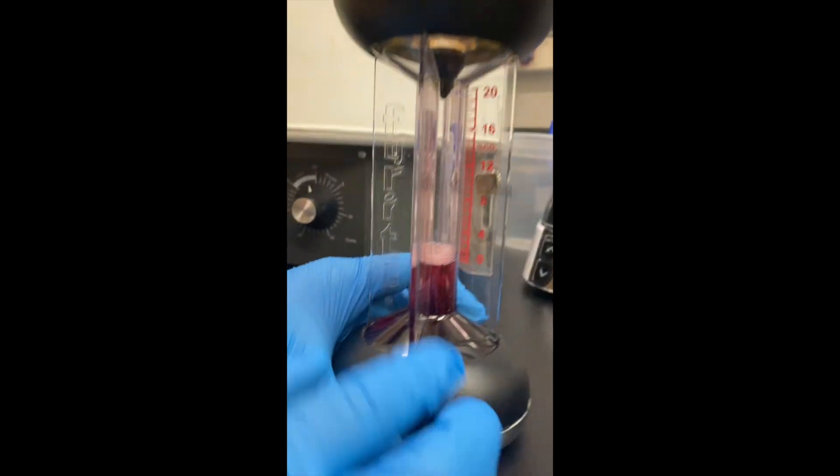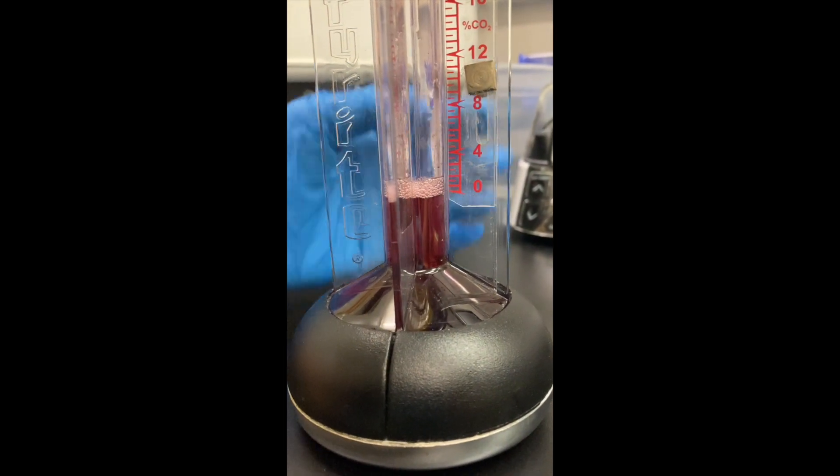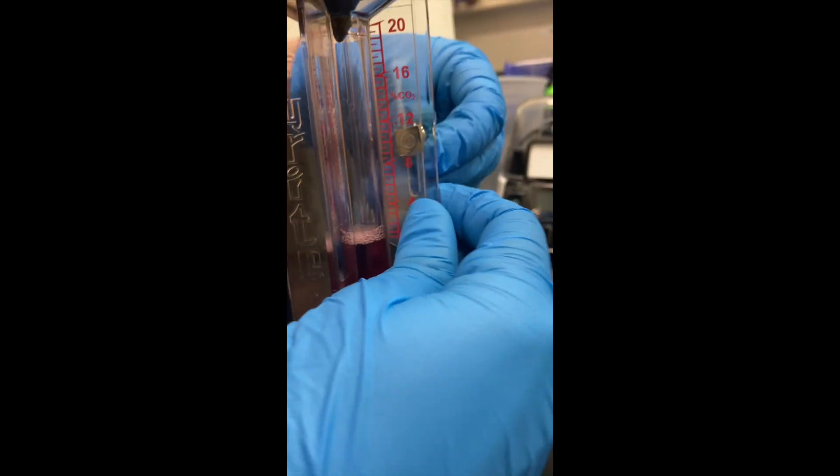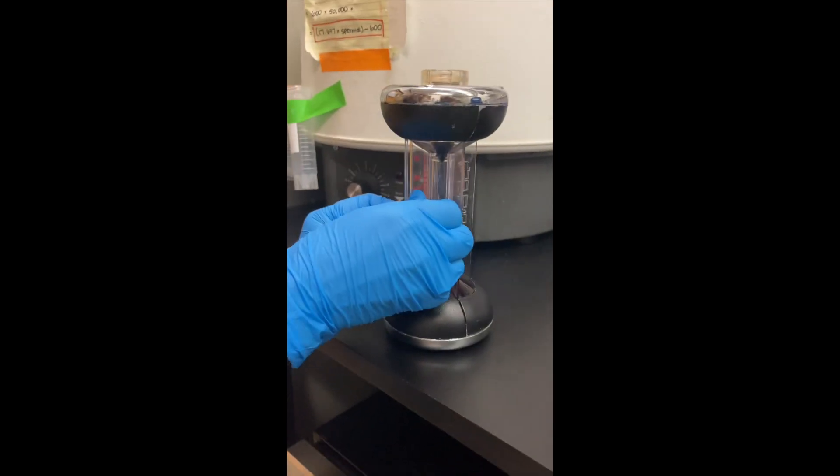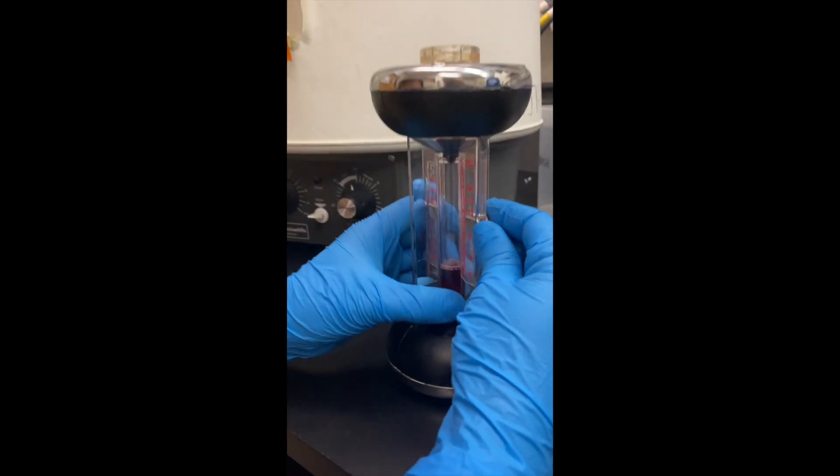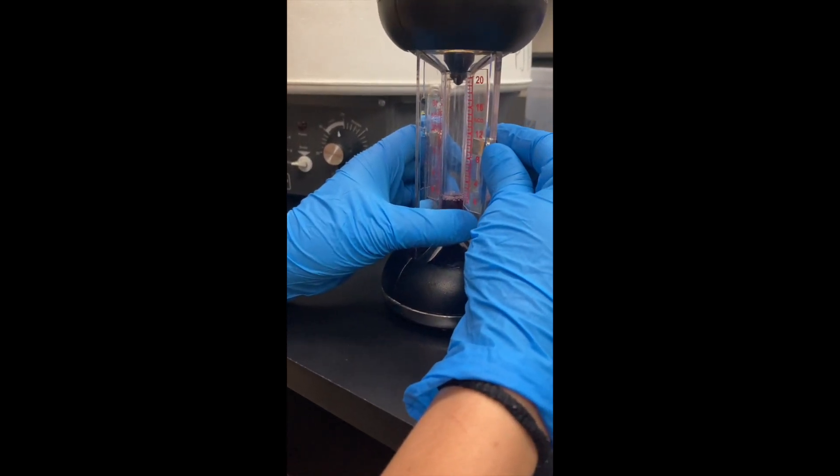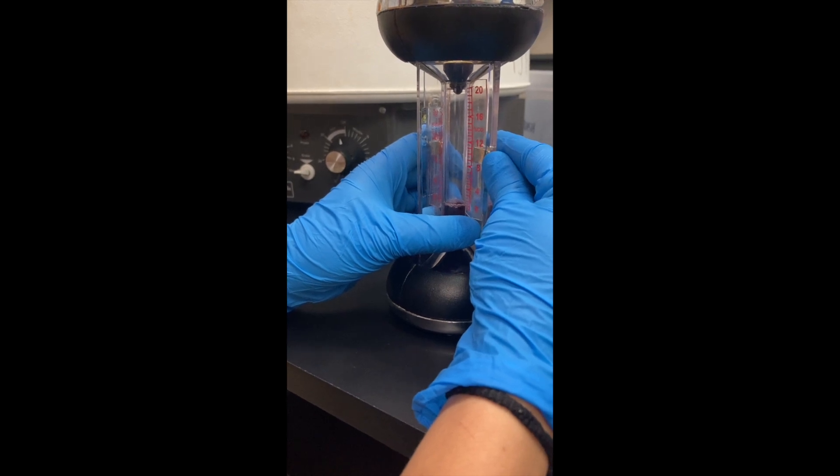So now this will be your zero. In that case, we can lower this a little bit to have this as zero. So here there is this thing, and then you can just make sure you have it as zero.